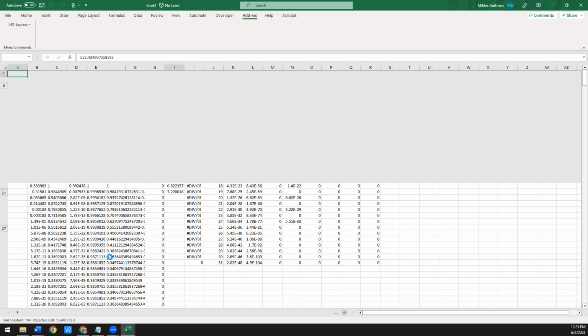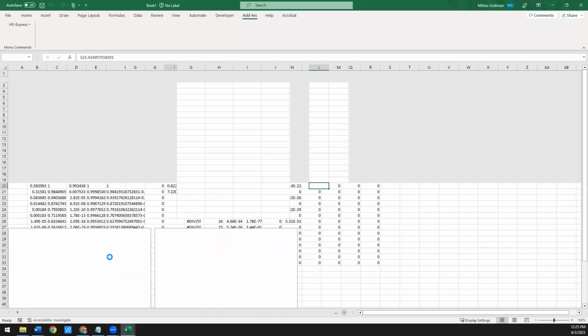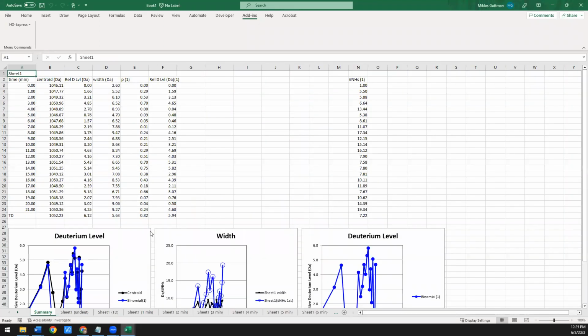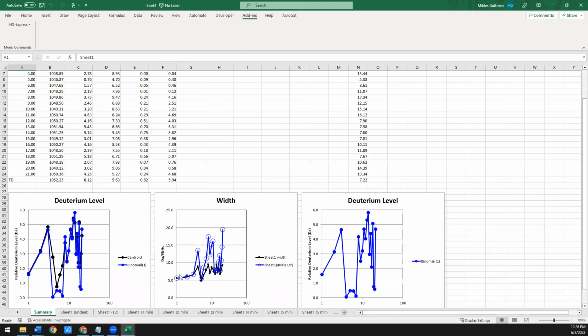Depending on what version of Excel you're using, sometimes it will actually update the screen so you can see the fits as they're happening. In this version of Windows, it just kind of blocks you out until everything's finished. Okay, that was the last step. Okay, so it pops you back to the summary window. And now you can see it's been updated.